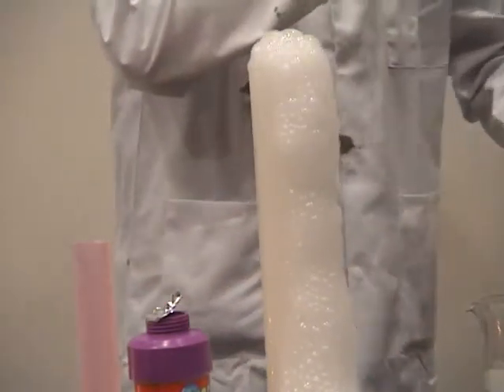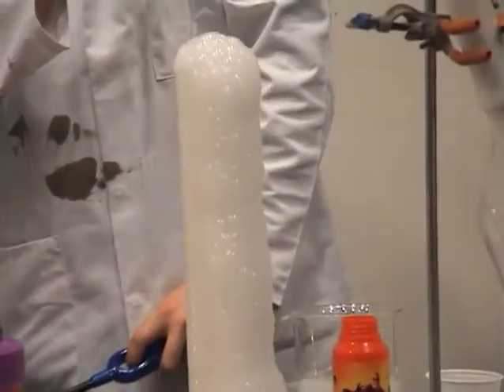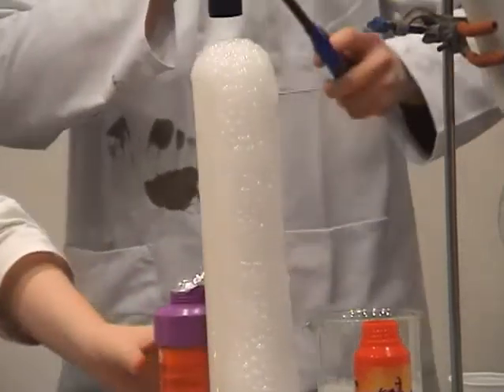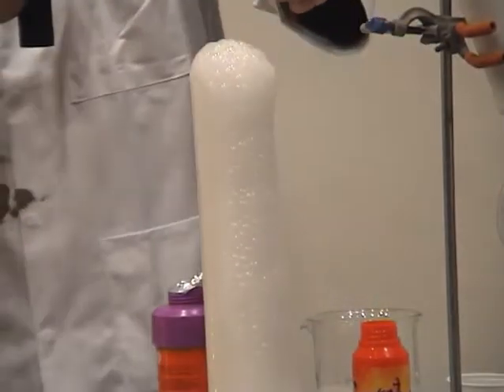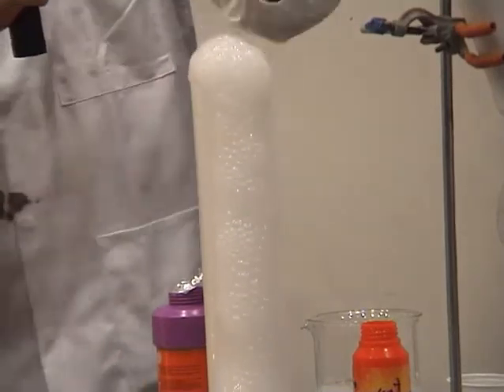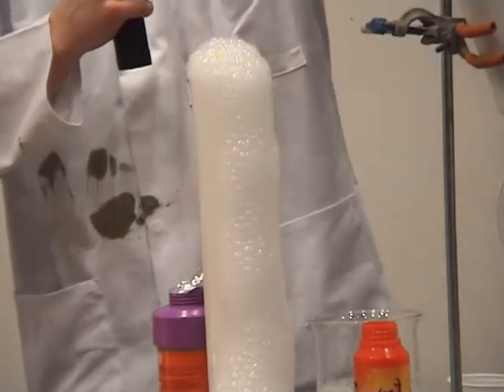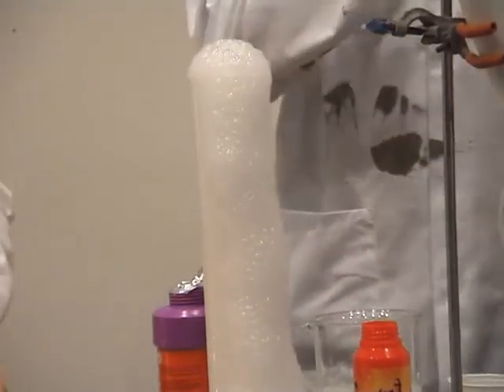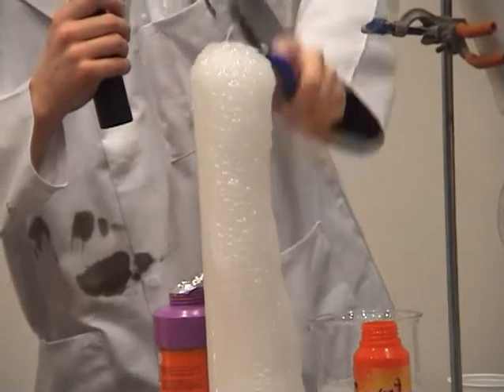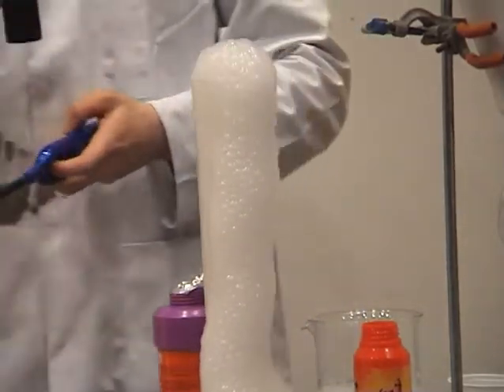Right, settle down. We have our flames here, and the bubbles full of CO2, so you think it'll blow up when you bring the CO2 near it. So, oh no, nothing happened. The flame went out because of the CO2. Carbon dioxide does not support the flame, as you can see there. The flame goes out.